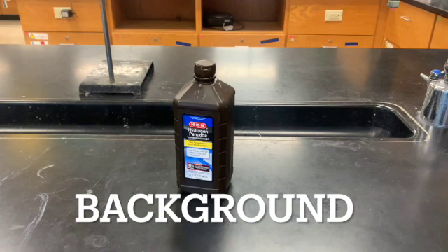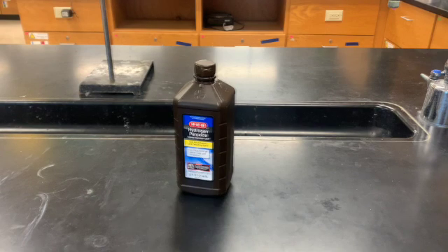The decomposition of hydrogen peroxide in aqueous solution proceeds very slowly. A bottle of 3% hydrogen peroxide sitting on a grocery shelf is stable for a long period of time. Take time to look over the equation that is provided for you in your lab.